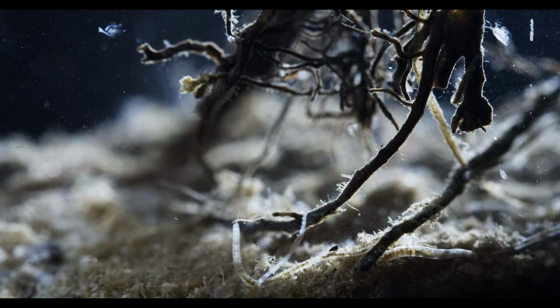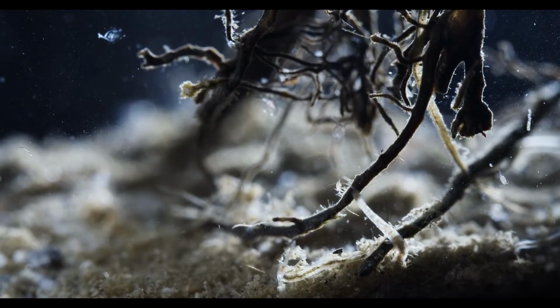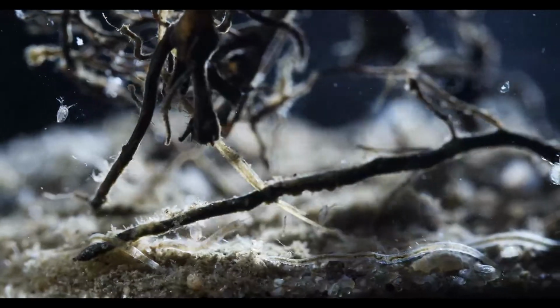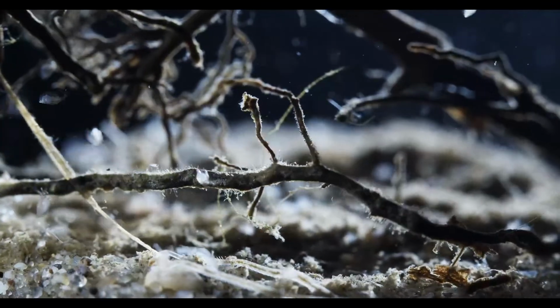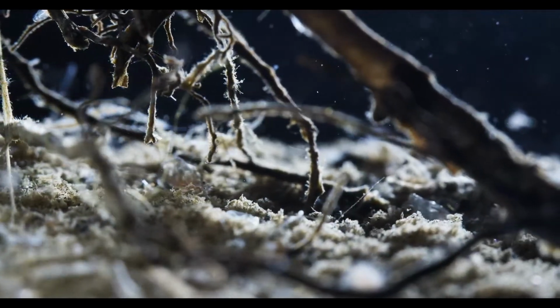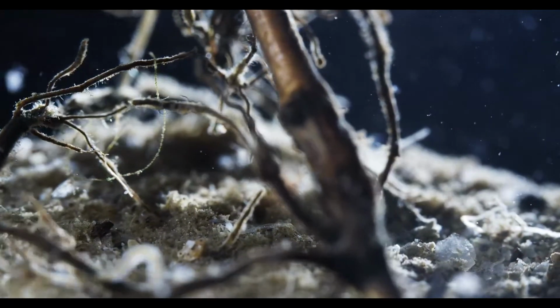And right now in the middle of the screen there's a teeny tiny nematode wiggling about also. Yeah, so these worms would both be, neither of them would be damaging to an aquarium, I guess. But yeah, I mean, when I see people identifying them as detritus worms, I think a lot of these people think there's basically a species of worm called detritus worm.